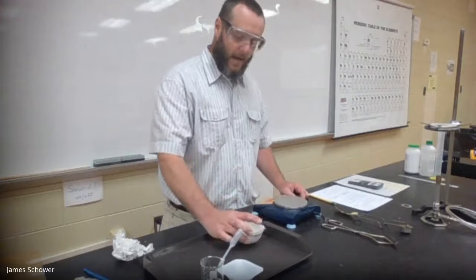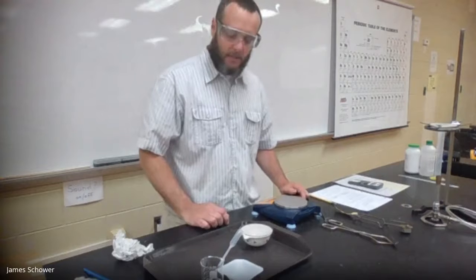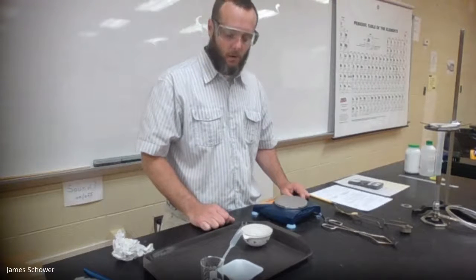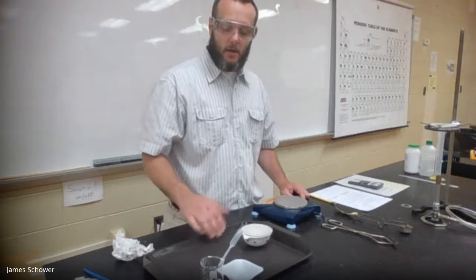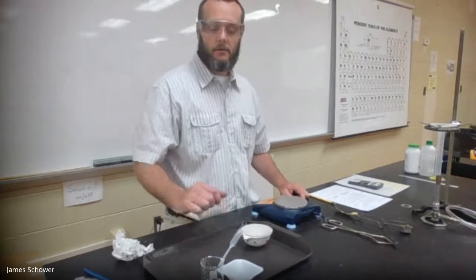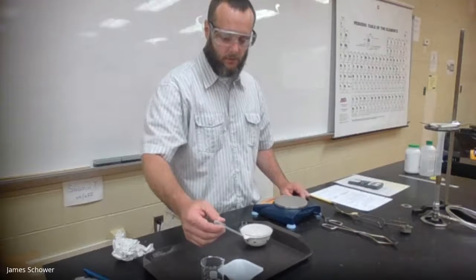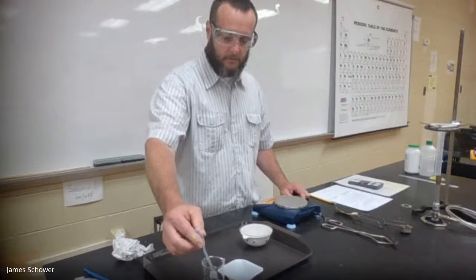Now we have our substance. Now we need to begin reacting it with hydrochloric acid. The question is, how do we know when the reaction is complete? Well, first off, we're going to get bubbles, CO2 bubbles. That's a gas. Once that gas stops forming, the reaction has subsided. So let's begin. We have to add approximately 20 mLs. Not all of it. We're just going to keep adding until we use enough. We don't want to over add any acid.